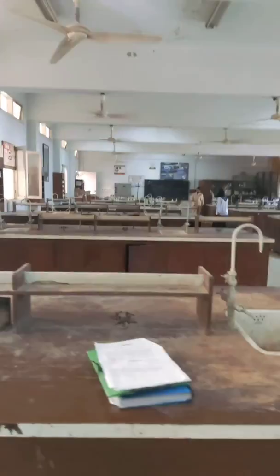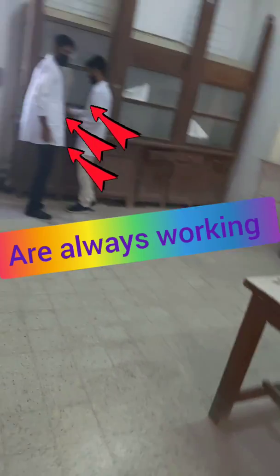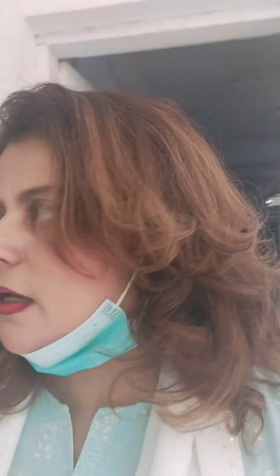I asked the students what they were mixing — they are taking the solutions for their experiment. It looks in a good state. My students are working and I'm very happy that they are doing their work. It's only my students here today — the organic chemistry group — who are performing this experiment. There is no one on the other side, so it's only my class performing today and I'm very happy for them.